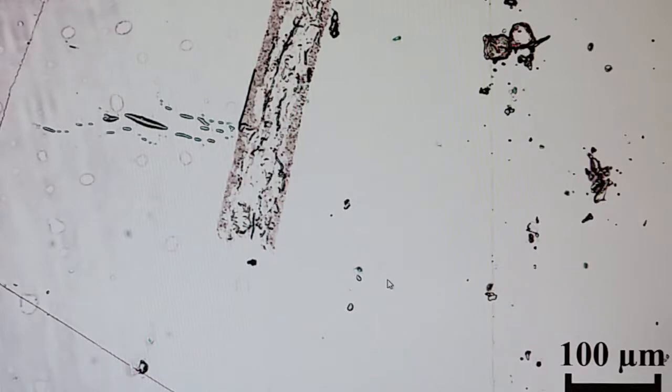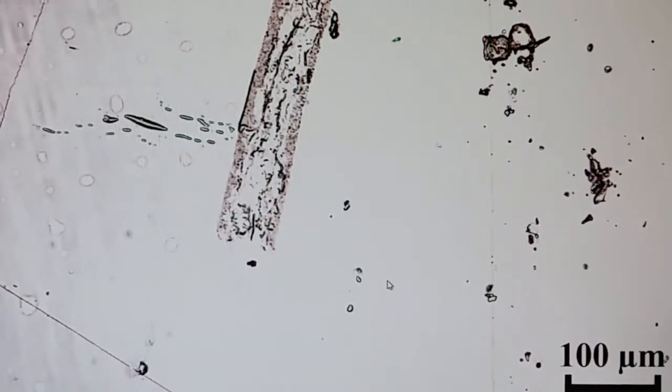And you know that enhances the effect when the refractive index changes in the material. If you have phase contrast, for example, then you know that different material with different refractive index will have different contrast. But in differential interference contrast, it is the change of refractive index that's enhanced and made into great contrast. So it's sort of like the derivative of the phase contrast image.